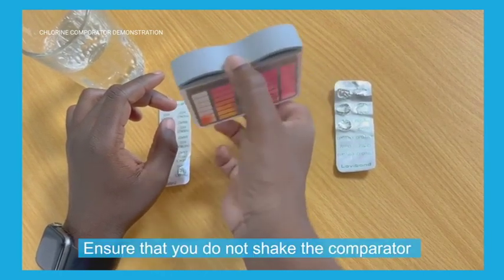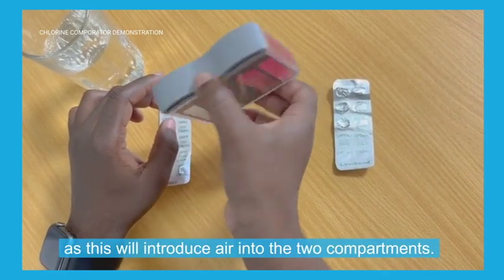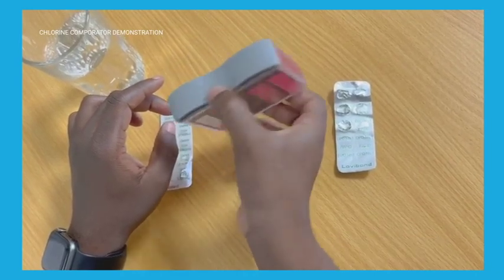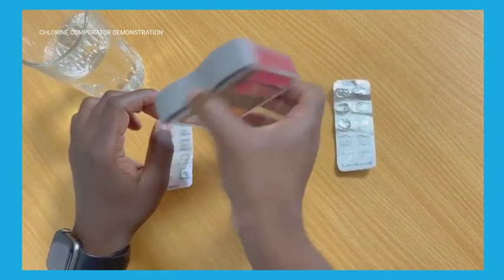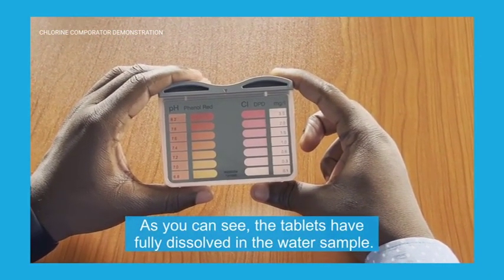Ensure that you do not shake the comparator, as this will introduce air into the two compartments. As you can see, the tablets have been fully dissolved in the water sample.